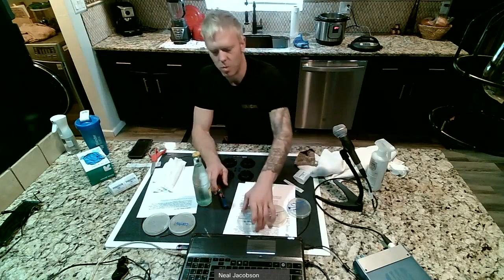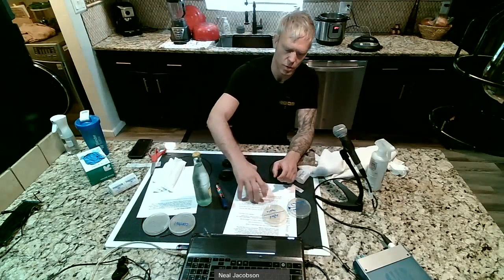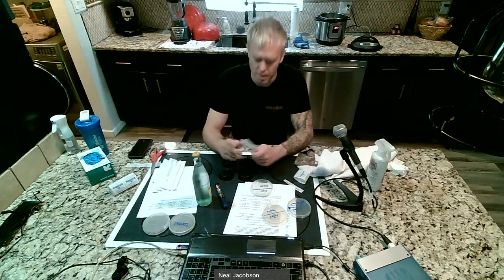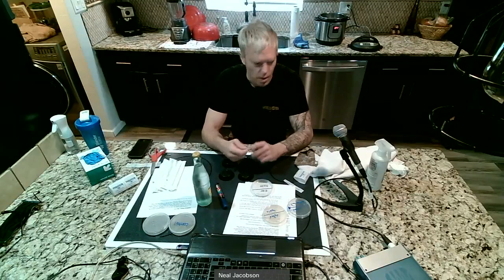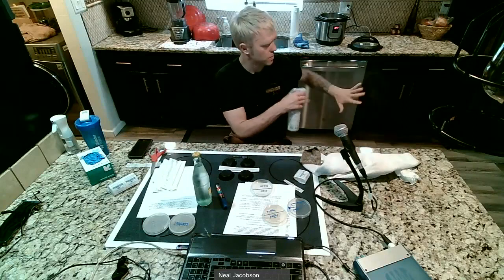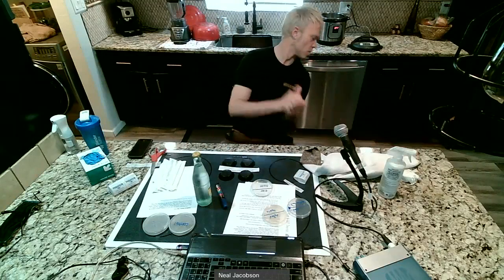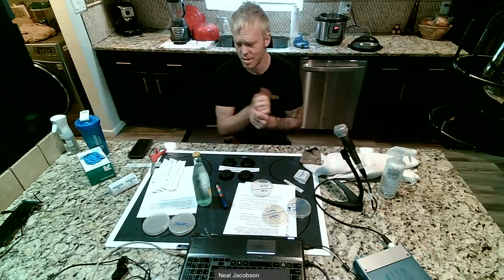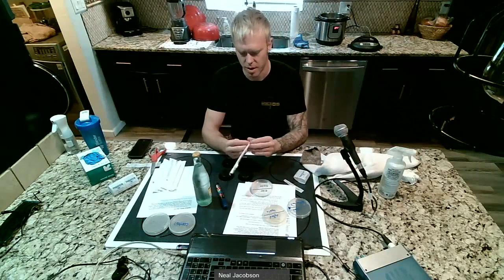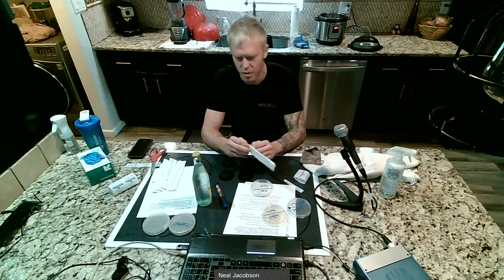Okay, so how is this going to work? Once you've labeled your petri dish, you can flip it right side up, and then you're going to take a swab. What I recommend is making sure your hands are clean. So you spray off your hands. Make sure your hands are clean. And then these are sterile swabs that are in your lab kit. So you don't have to sterilize these.